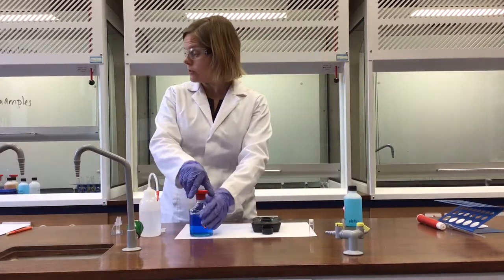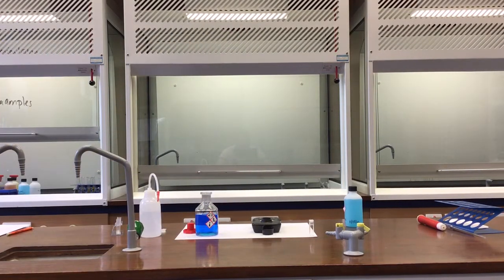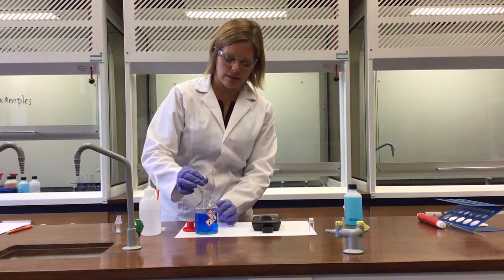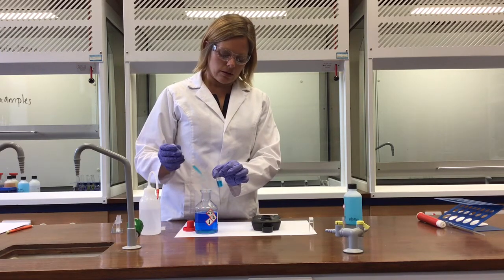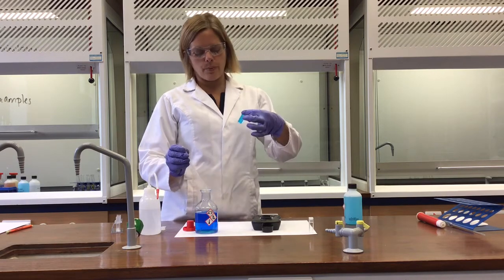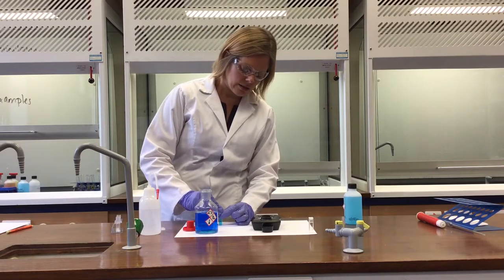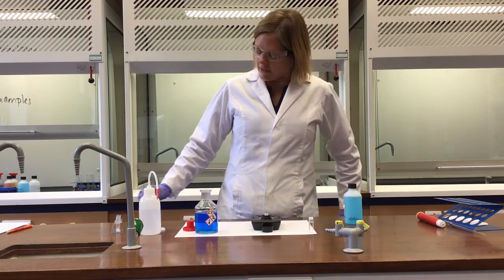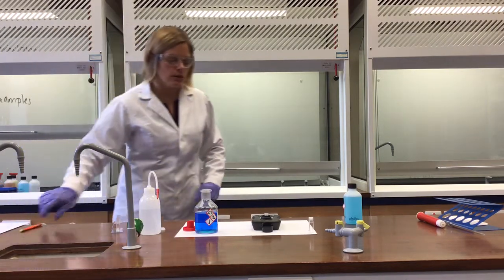The second one I could do, if I wanted to, is the copper(II) sulfate. So I'm just going to get a dropping pipette from around the lab so that I can add that to the sample. So I take a dropping pipette, add some of the 1.00 moles per decimetre cubed solution to the cuvette like this. Check that there's no air bubbles, that's important, so that there's no scattering of that light. Pop the lid on it, gloves out of the way, and sit that one into the reading. And that's 1.64 for the 1.00 moles per decimetre cubed solution.